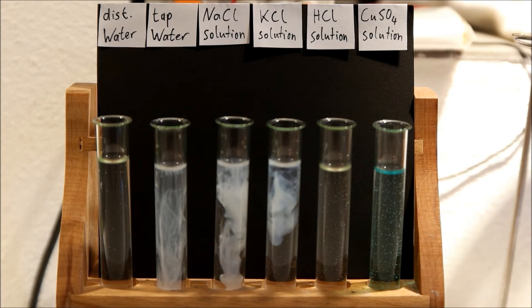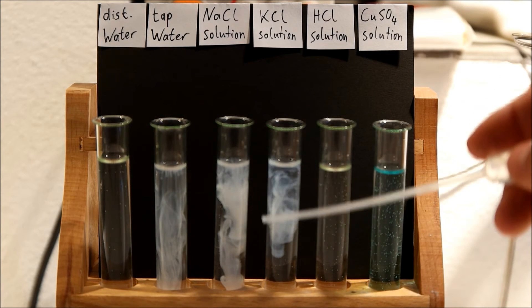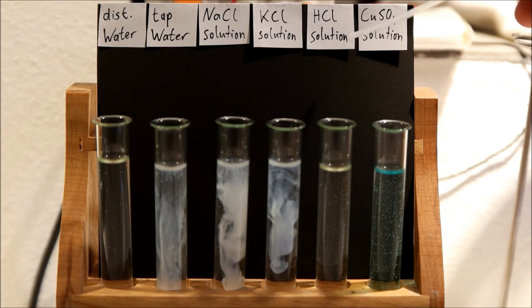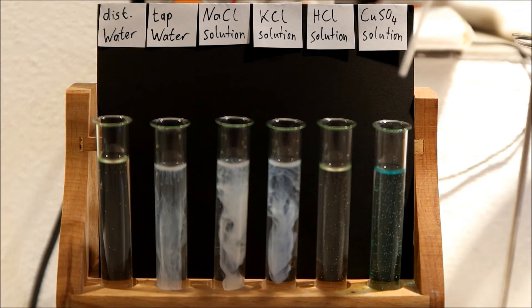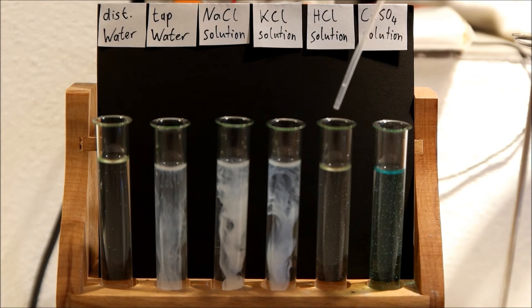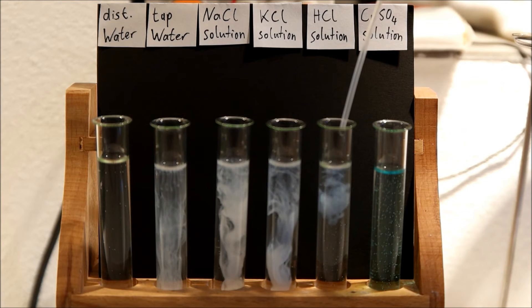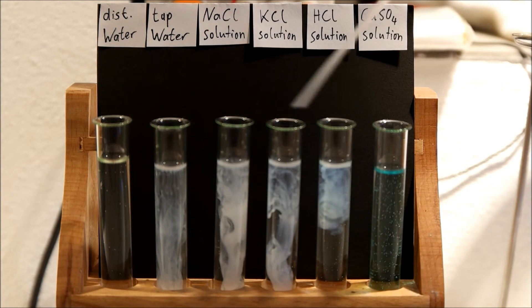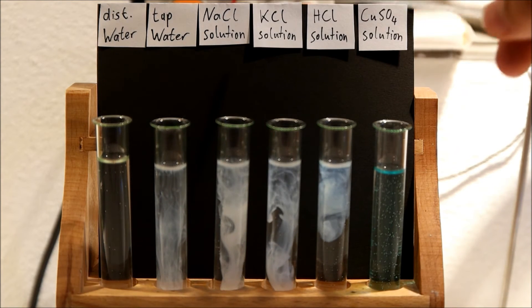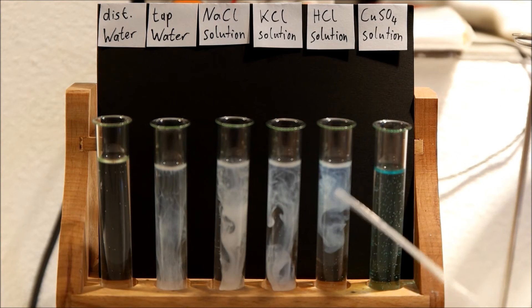The potassium chloride solution shows the same result. And here we have HCl, which is hydrochloric acid, and you can see because they are all chlorides, you can see this white fallout.